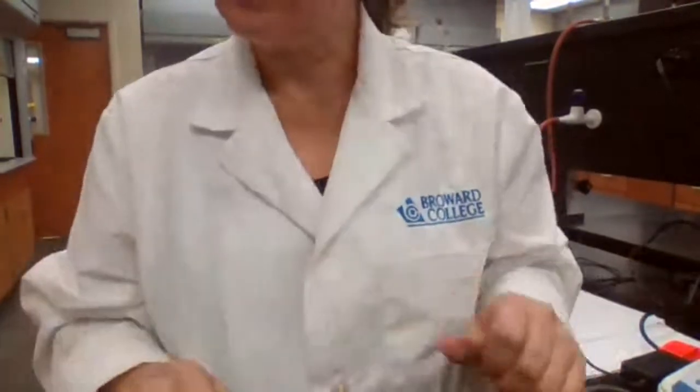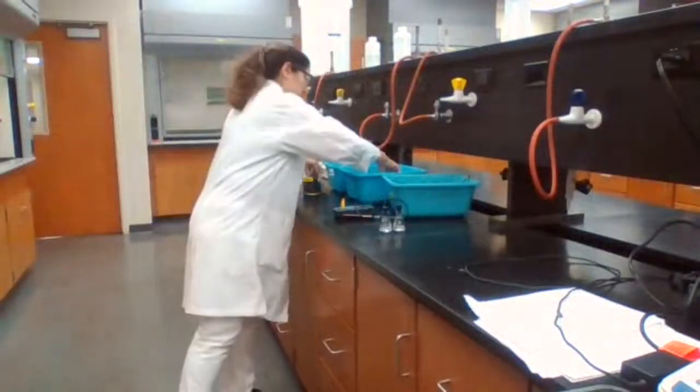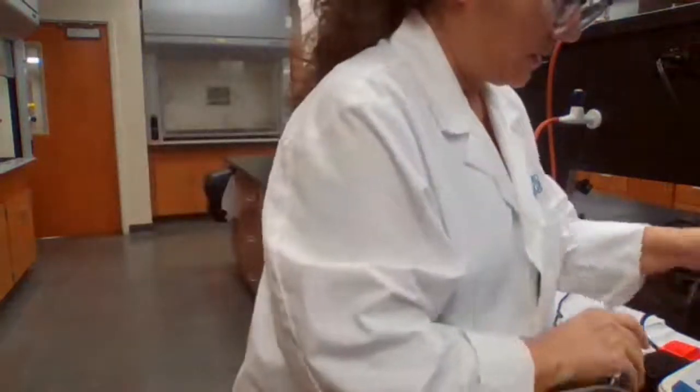Okay. For unknown B, you're going to have to do a different liquid, unknown control.